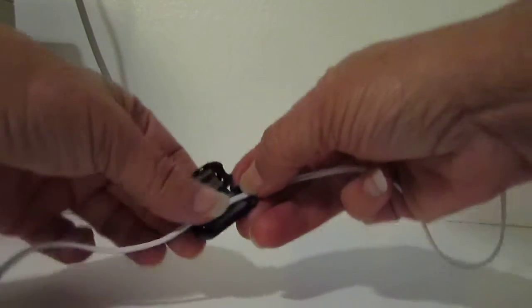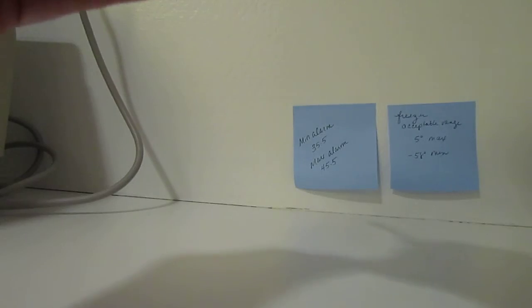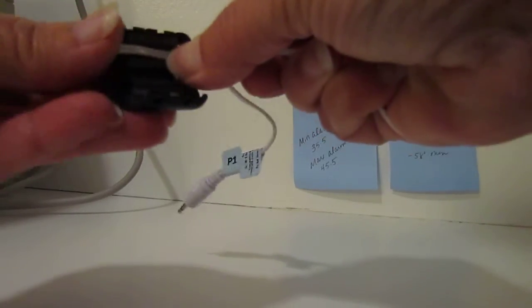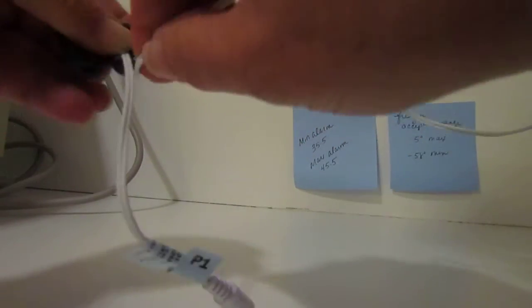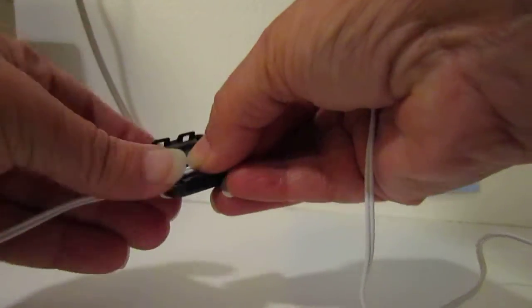Then you're going to wrap it around the outside or as the directions say loop it around. You're going to do the long end of that around there like that and bring it back inside.